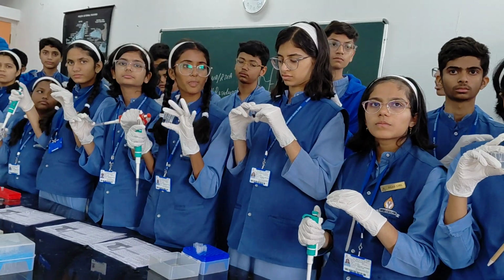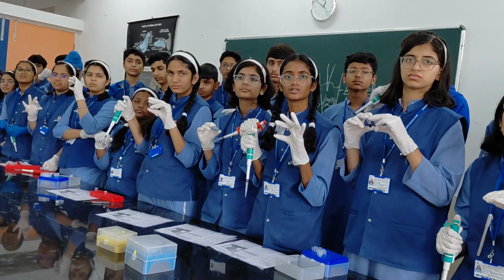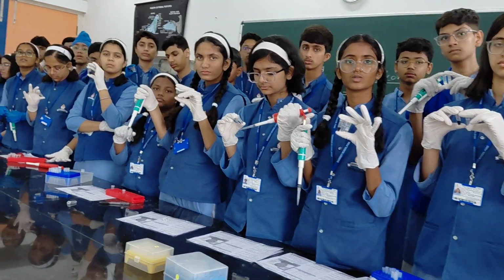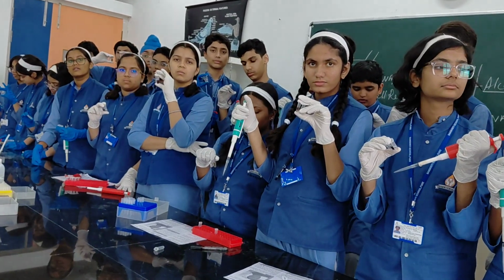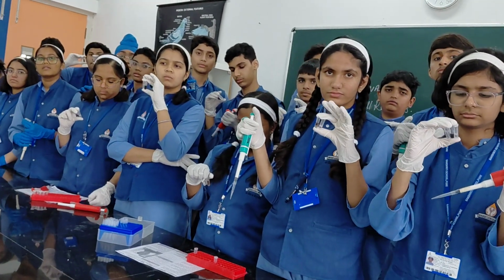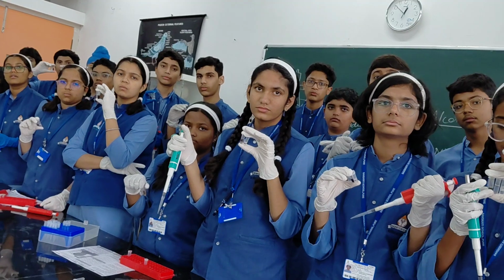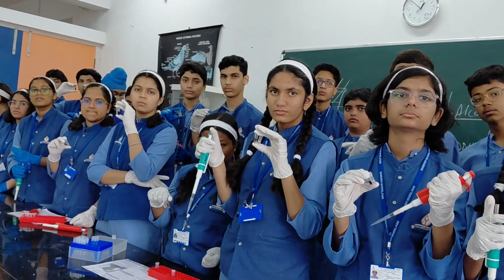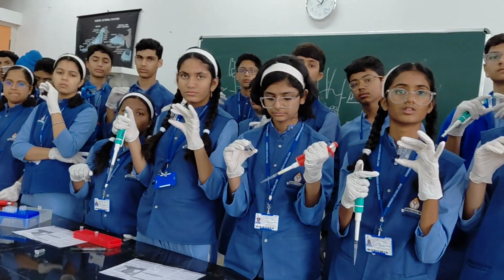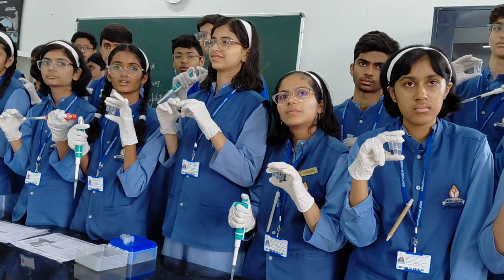After this, a 10-minute experiment is left to do DNA fingerprinting. 5 chemicals and your DNA, 2 microliters, will be added in one tube and your reaction for DNA fingerprinting is ready. Just put it on the PCR and run gel electrophoresis, take the picture of the DNA fingerprinting. That will be the complete course of MSc Biotechnology up to the DNA fingerprinting level.